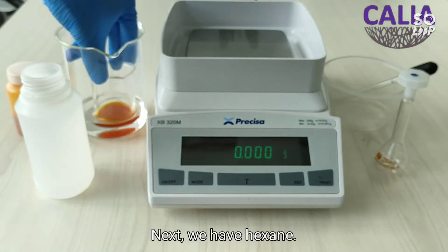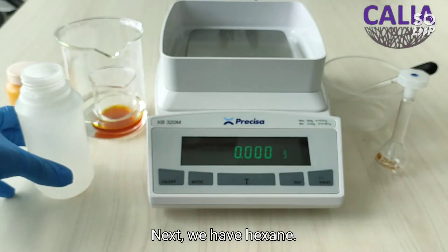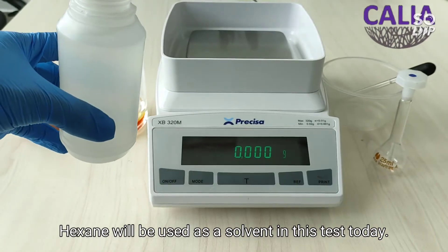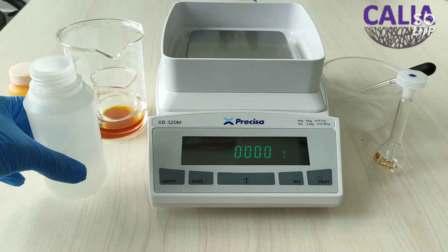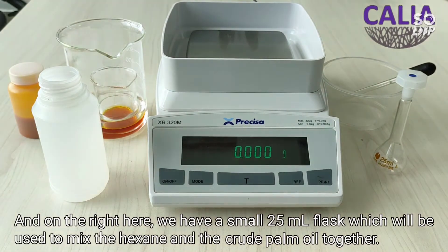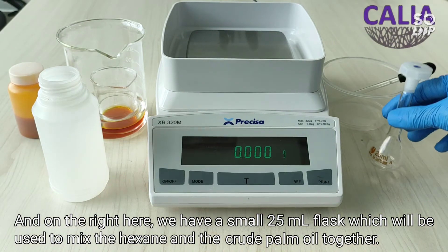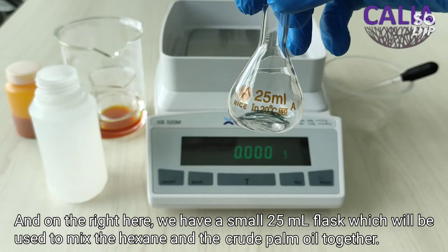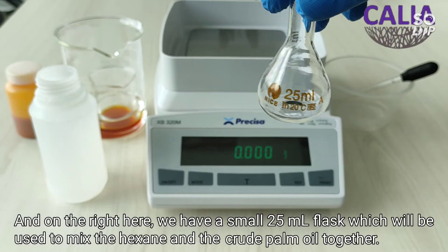Next we have hexane. Hexane will be used as a solvent in this test today. And on the right here we have a small 25 milliliter flask which will be used to mix the hexane and the crude palm oil together.